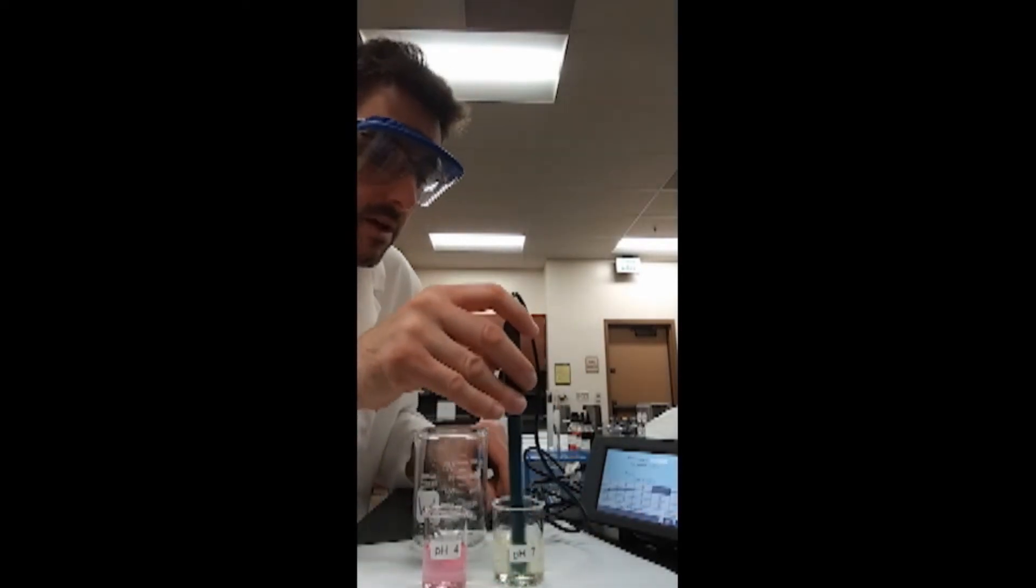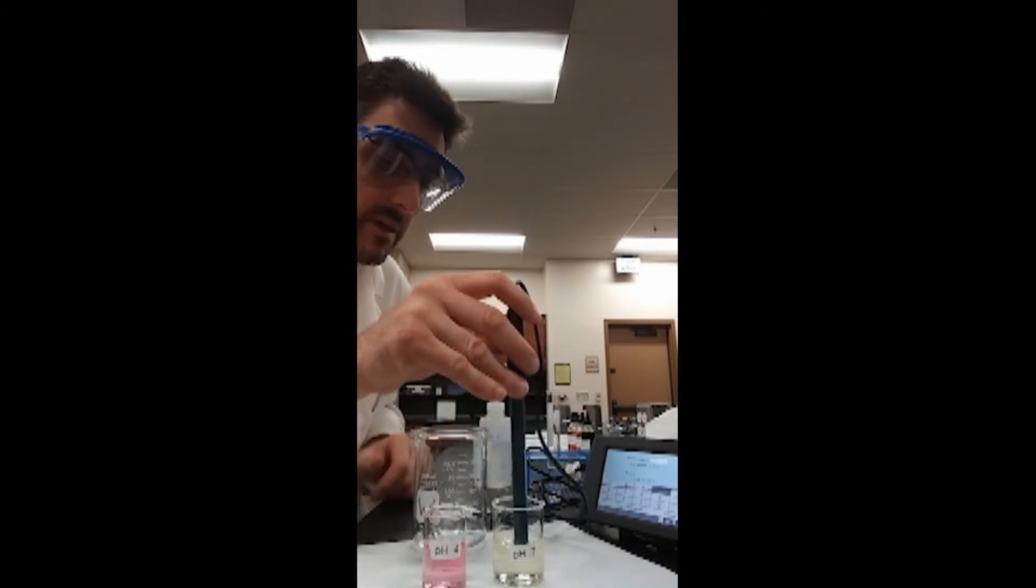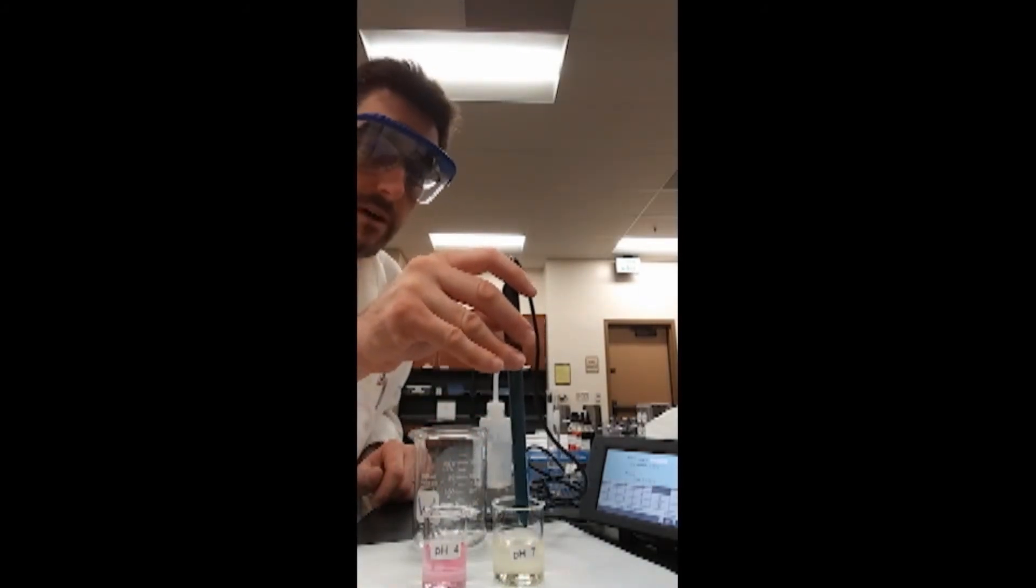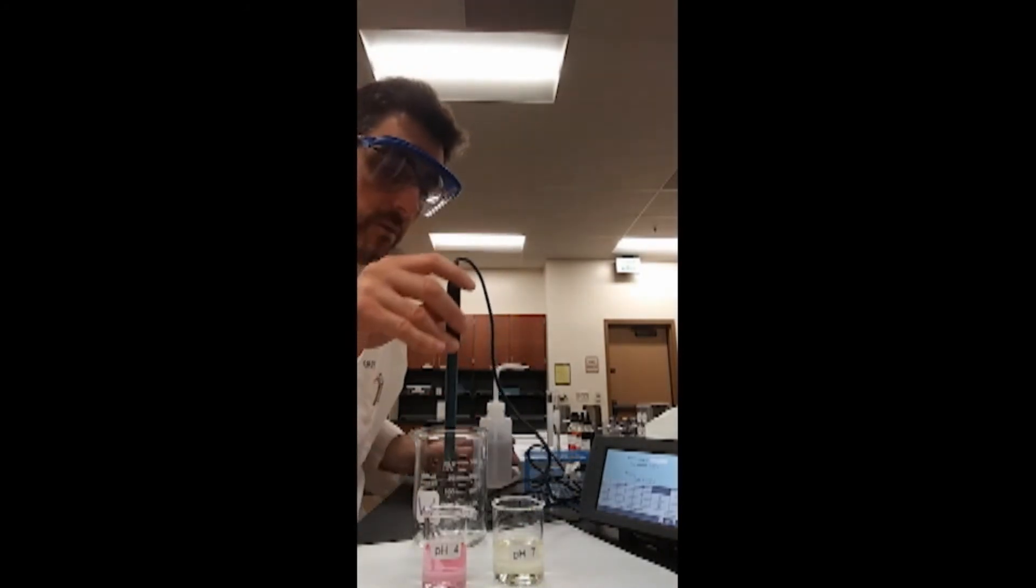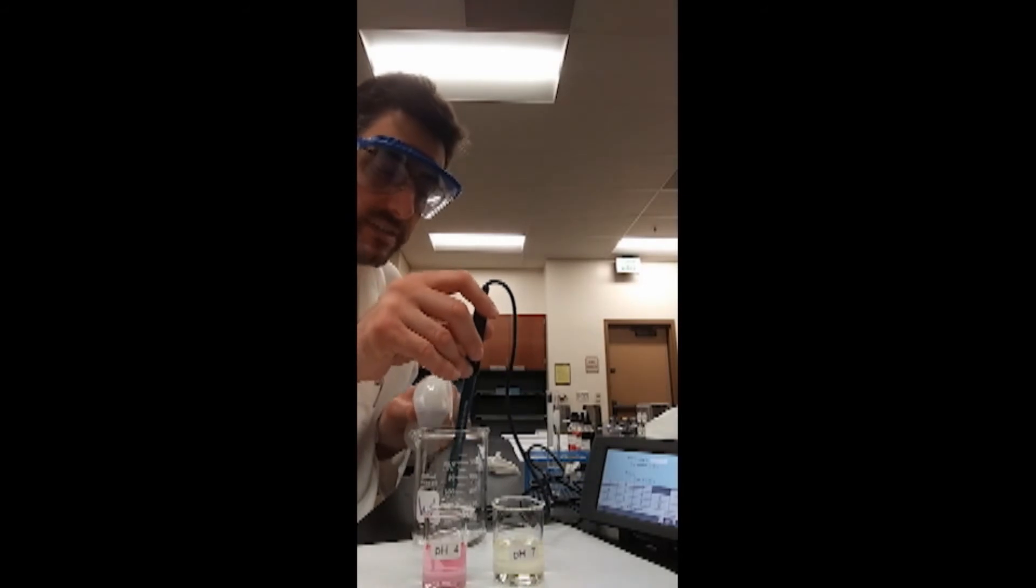And then, I'll prepare the pH probe for the second buffer solution. I'll remove the probe from the buffer and I'll rinse it off liberally with large amounts of deionized water.